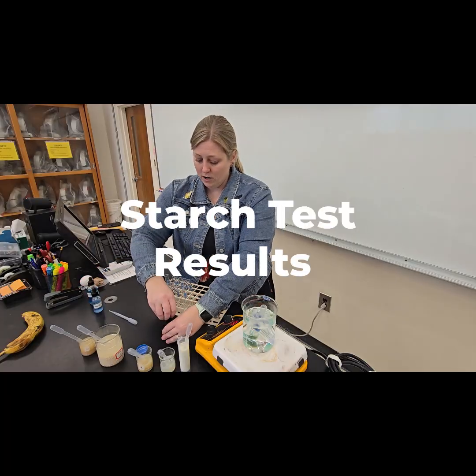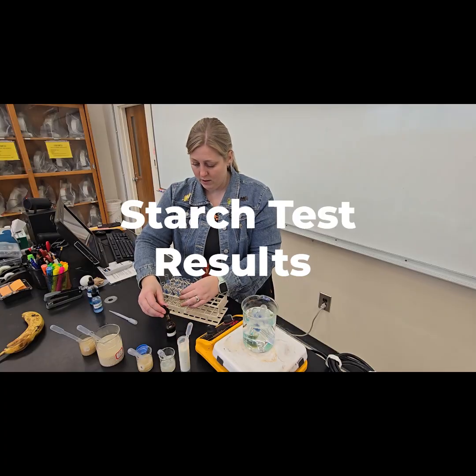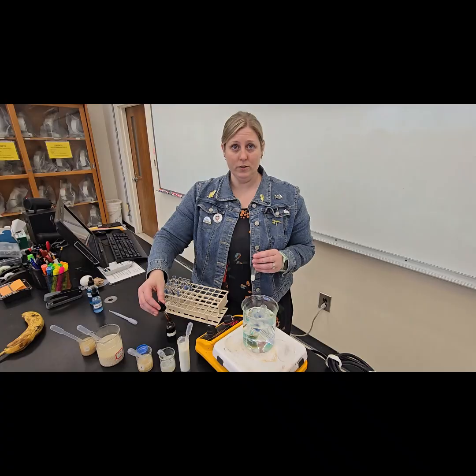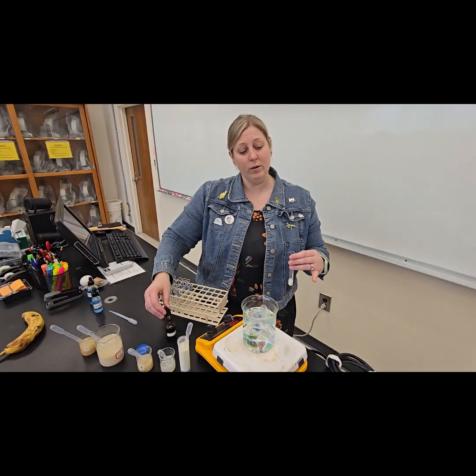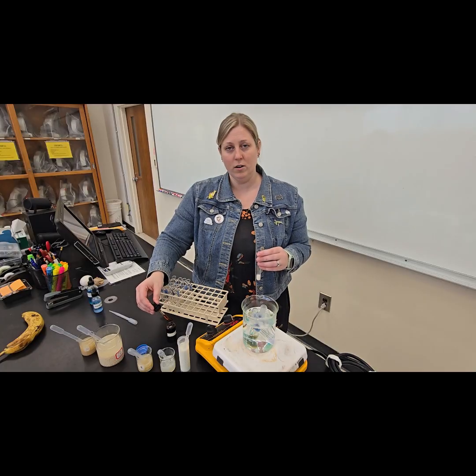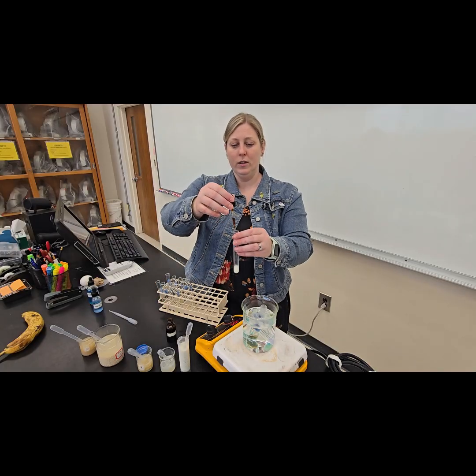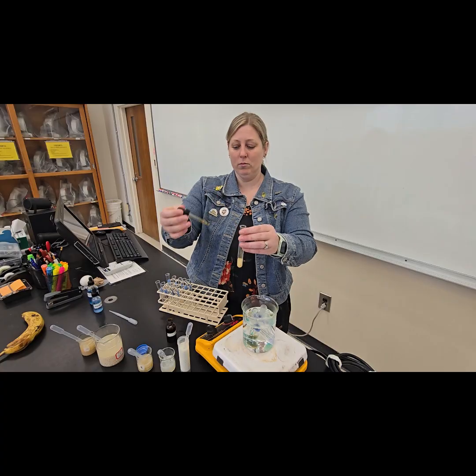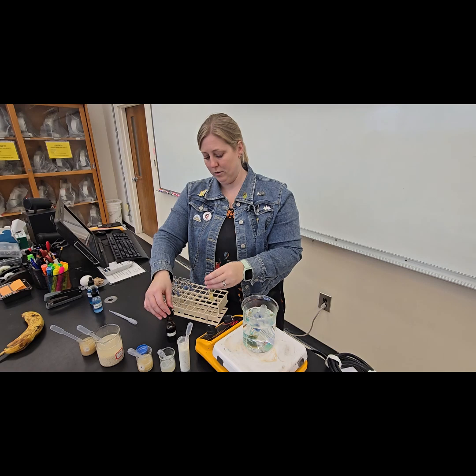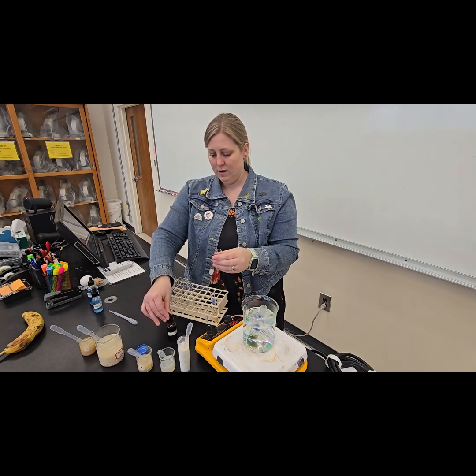So here is iodine with our milk. I am not telling you what the result is. You are going to interpret the result and you're going to write it down in the iodine test for each of these solutions and base it on your hypothesis. So, iodine in our milk. Okay, there is our result for milk and iodine.